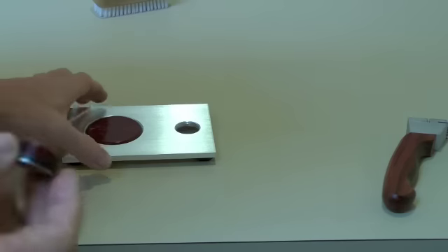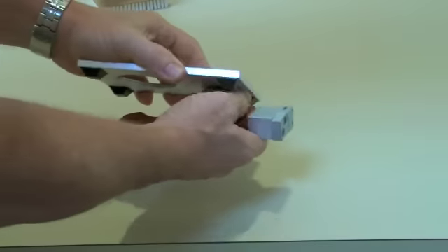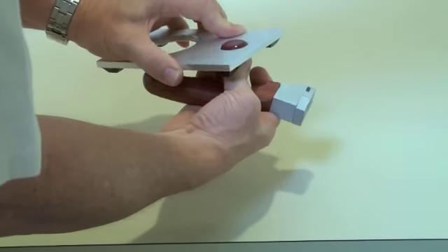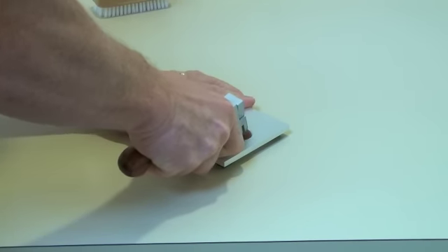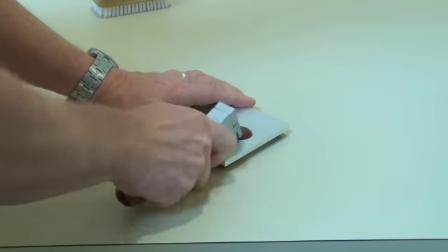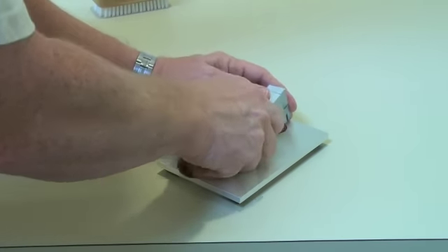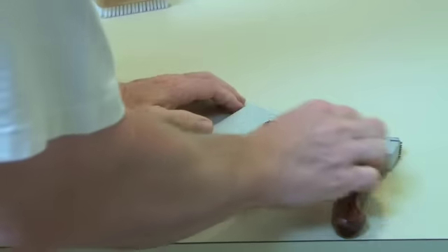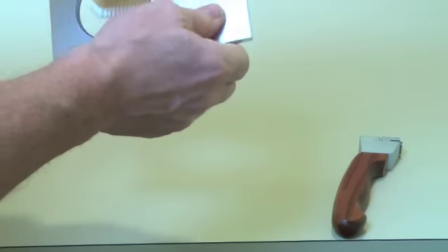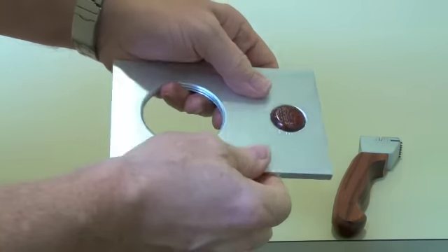For our next test, we are going to test the small drum plug. Okay, we line that part in. Pull the cutter across, and then rotate it 90 degrees. Press down. Pull the cutter across. So, with a little bit of practice, we should be able to get a good cut.